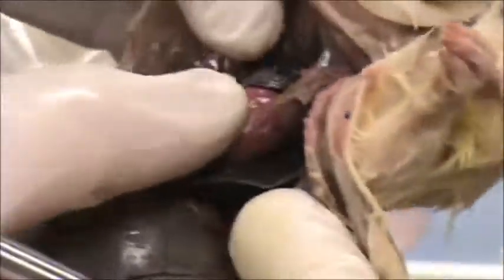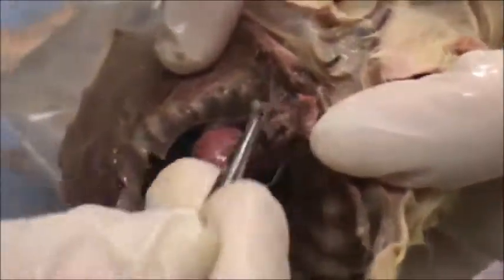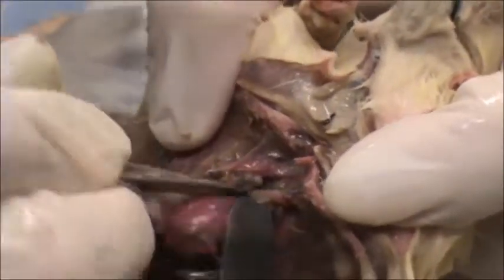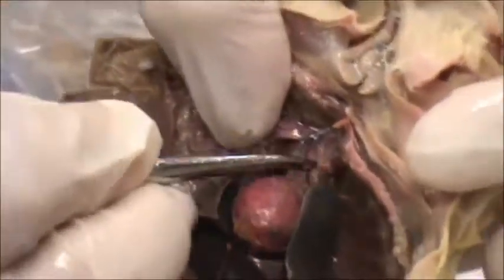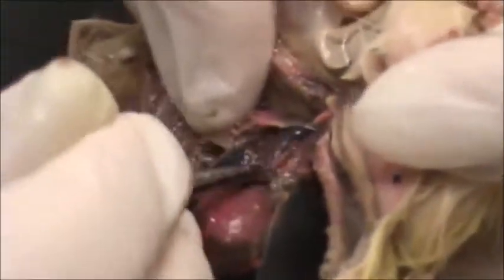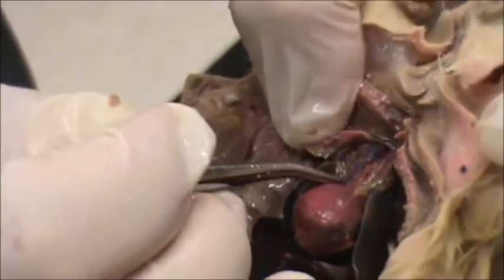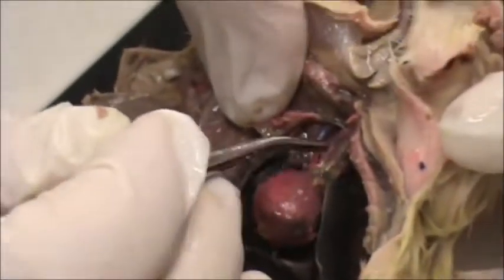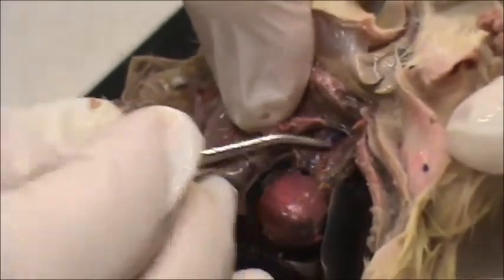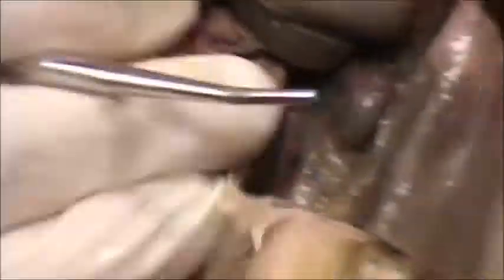And above the heart you're going to find your common carotids. I'm going to move the thymus aside and you're going to find the common carotids. These two large ones here are called the superior vena cava — so above the heart is the superior vena cava, and below the heart is the inferior vena cava.